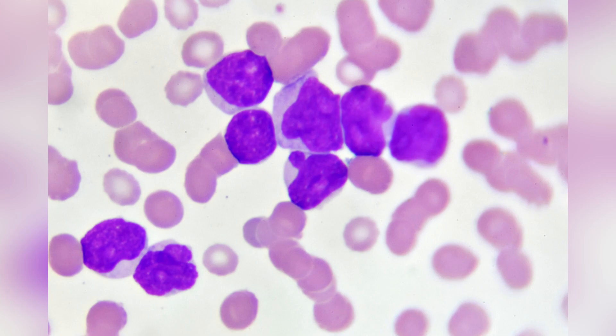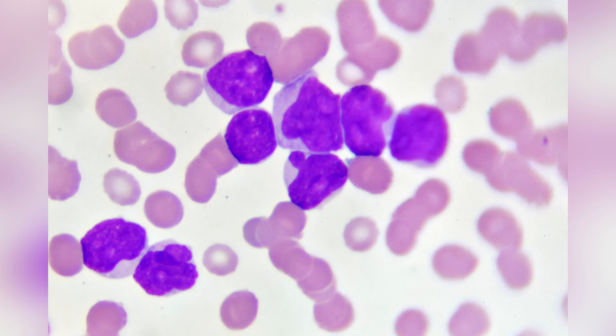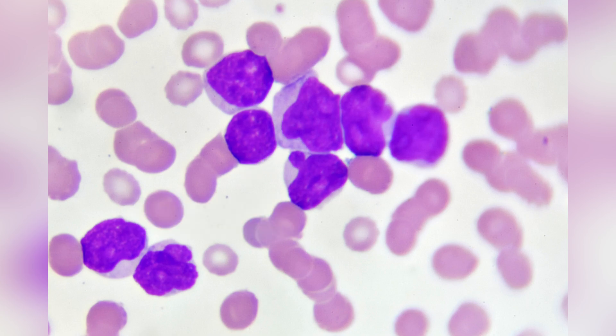As a result, patients with AML often experience symptoms such as fatigue, weakness, and frequent infections. The cells that we are seeing now are called myeloblasts. More than 20% of these cells are seen in the bone marrow itself.